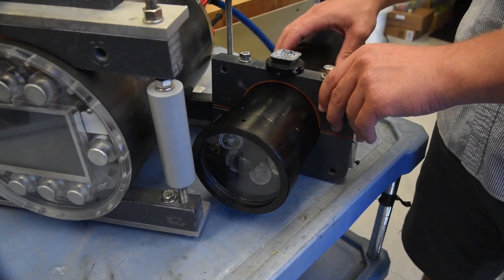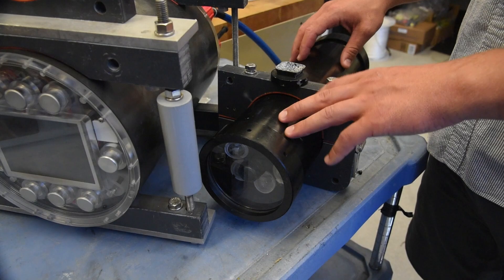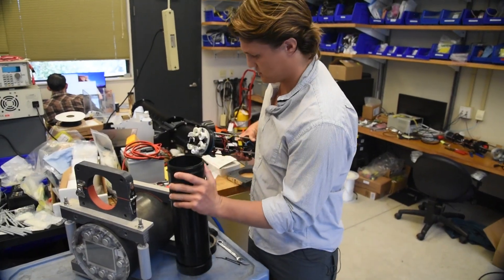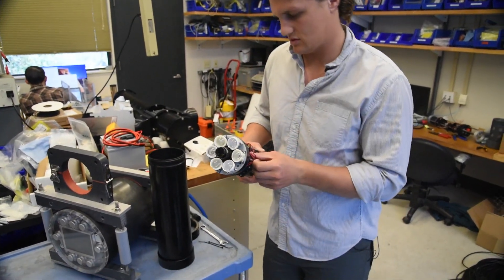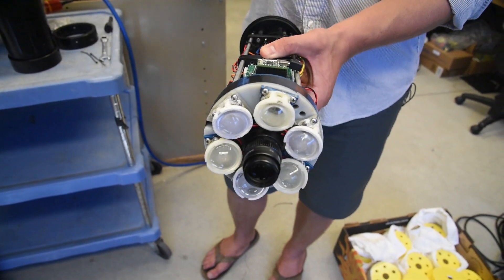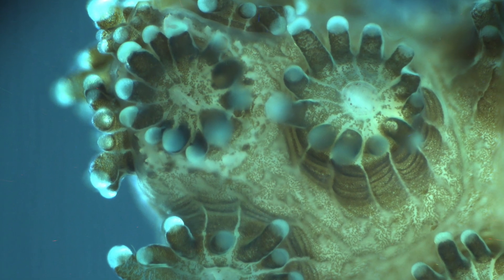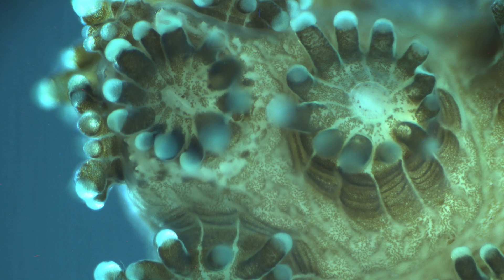One of the really interesting pieces of technology that we use in the instrument is this electrically tunable lens. It's a soft lens and it focuses the way your eye focuses — it changes its shape — and that allows us to accurately focus on the subject we want to image.